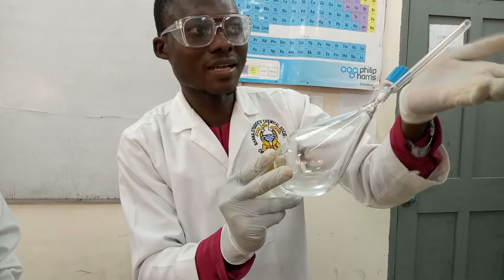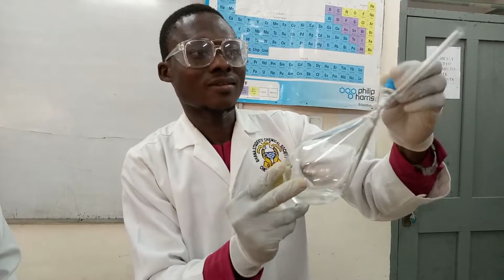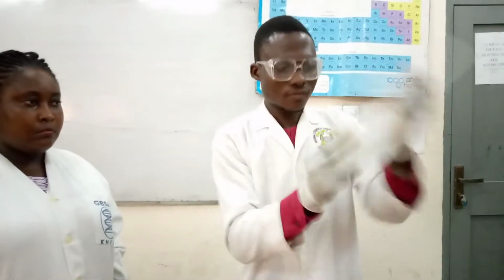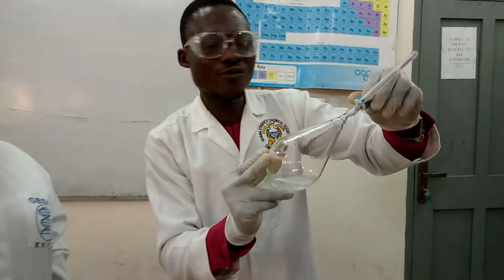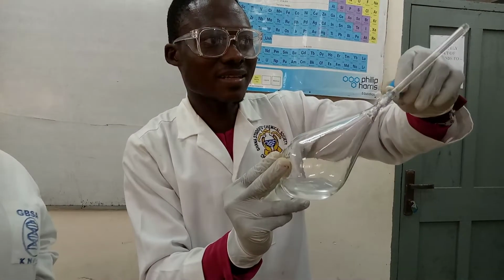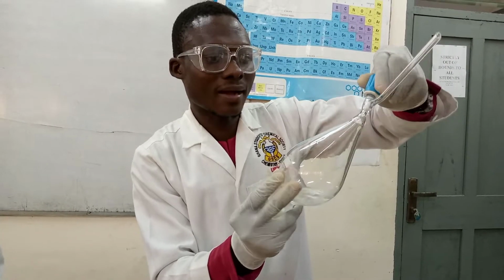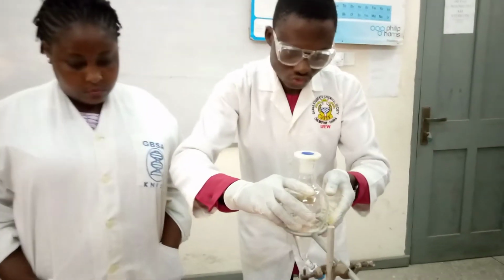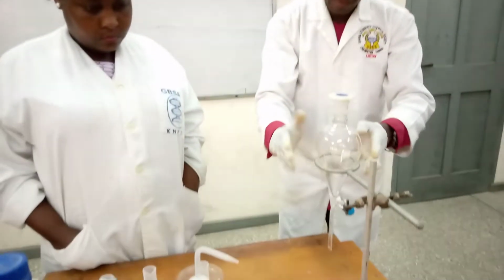You see that the pressure built is reducing as you are shaking. So this is my last. You can do it 4 or 5 times just to make sure that the reaction is done well. Then you close it back. Then I'll bring it back to my retort stand. I'll bring it back there.